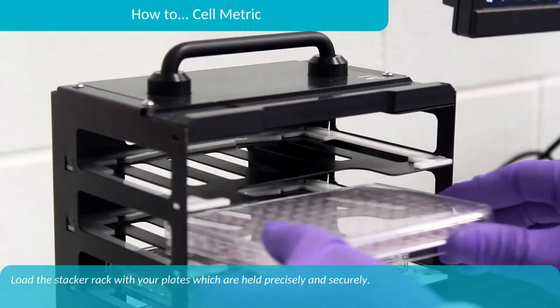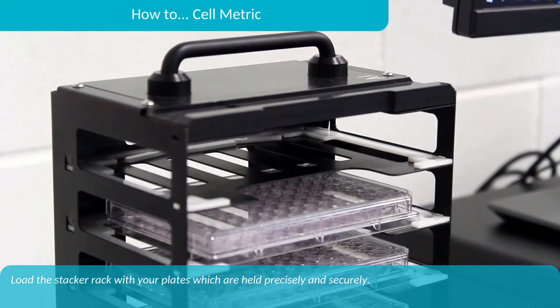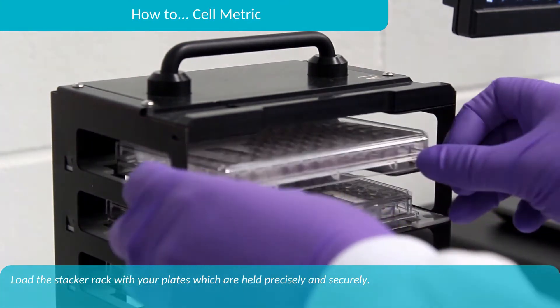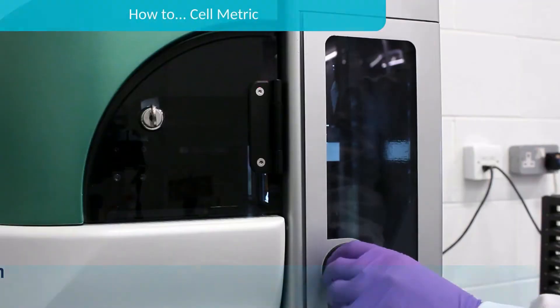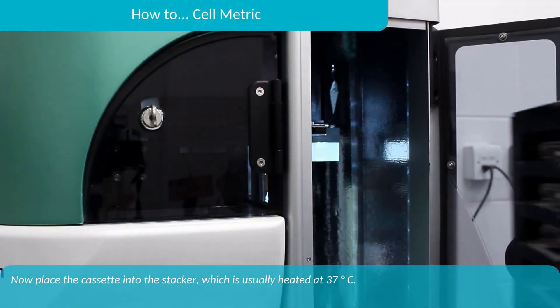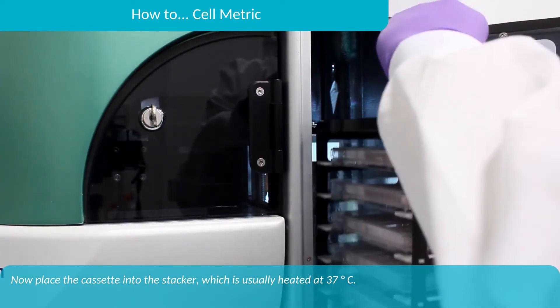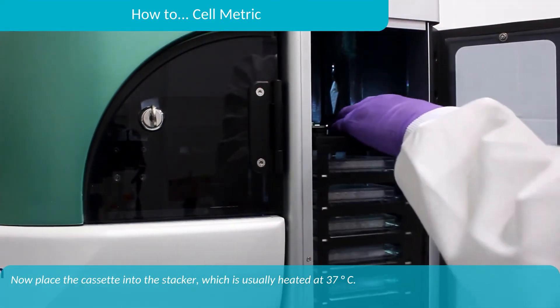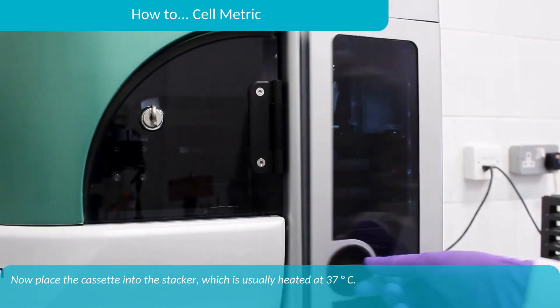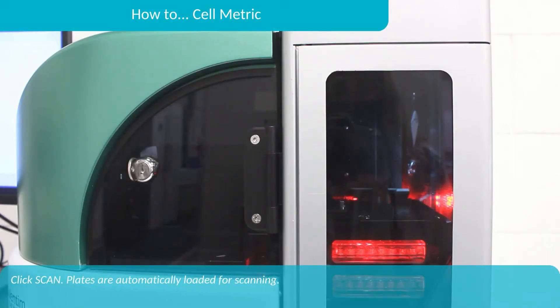Load the stacker rack with your plates, which are held precisely and securely. Now place the cassette into the stacker, which is usually heated at 37 degrees C. Click Scan.